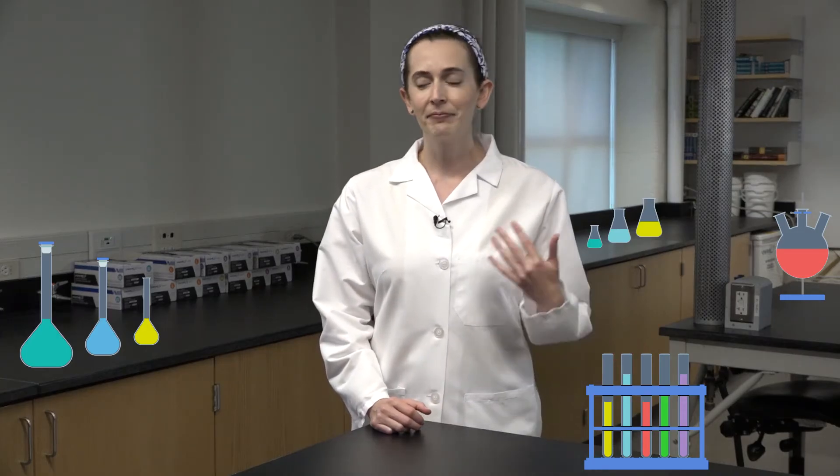You know how scientists on TV are always playing with beakers full of brightly colored chemicals? As a biologist, I get to do a lot of really cool things in the lab, but I am a little sad that, unlike TV science, many of the chemicals I use every day are in fact colorless.